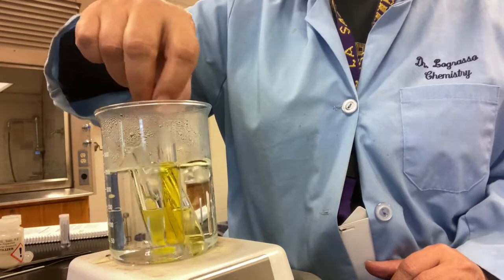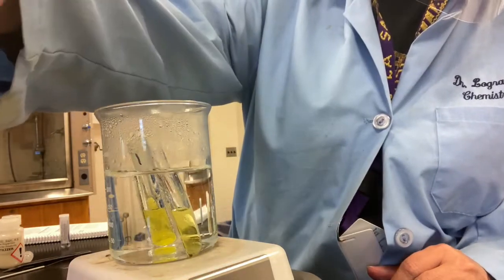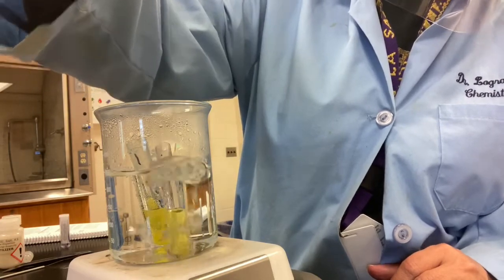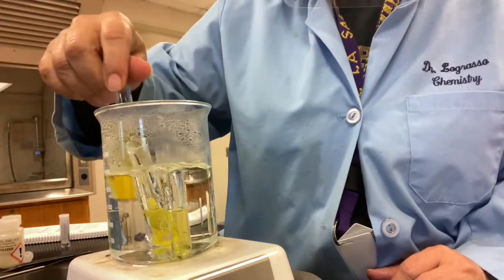So it definitely succeeded in our sodium phosphate, which of course we would expect because we knew it was sodium phosphate. Ouch. I don't see anything in the, I mean it's yellow, but I don't see a solid like I did in the sodium phosphate forming with the detergent. Oh yeah, it's a detergent, I'm sorry. I don't see it forming in the detergent yet.